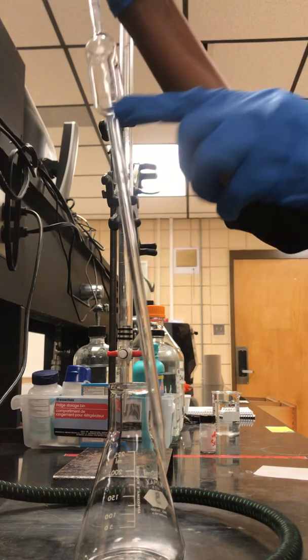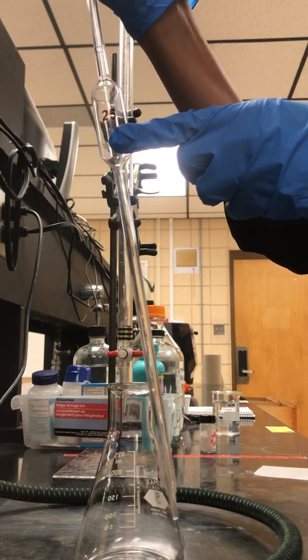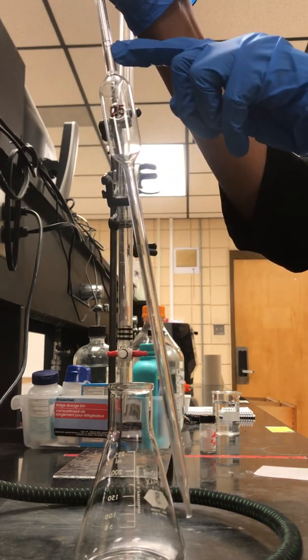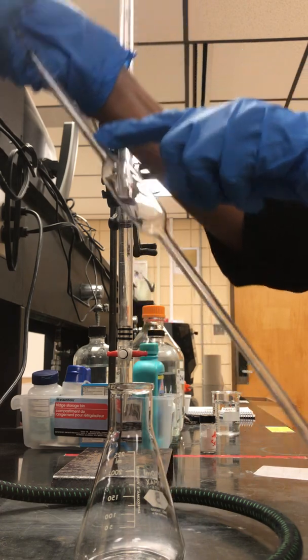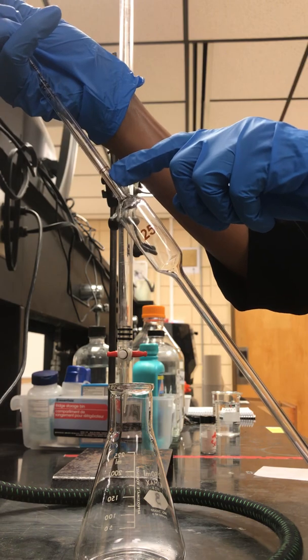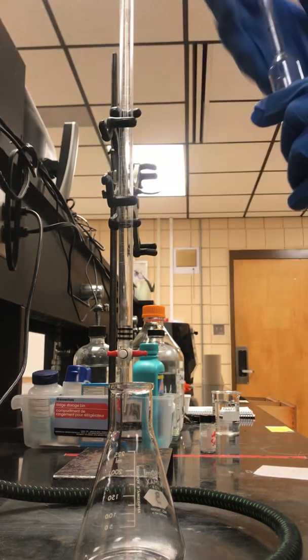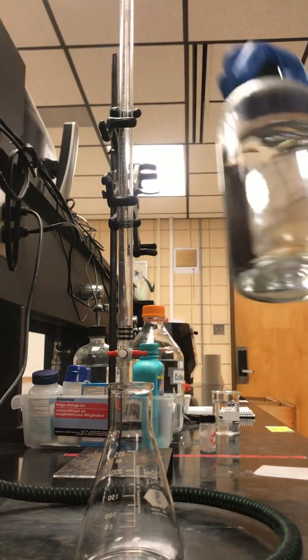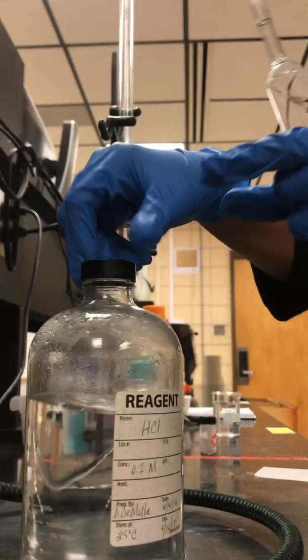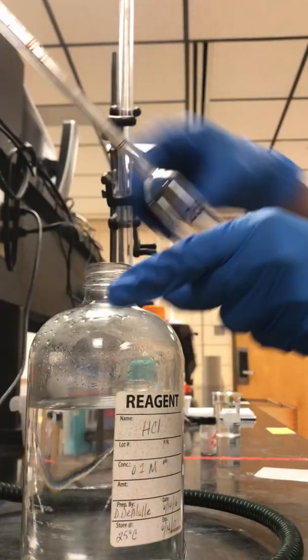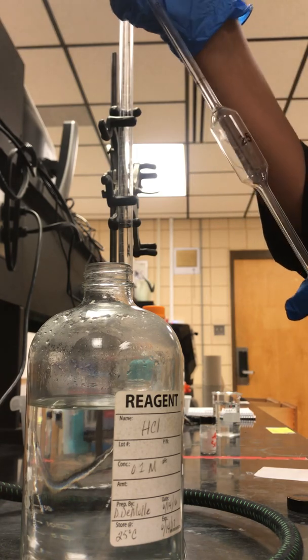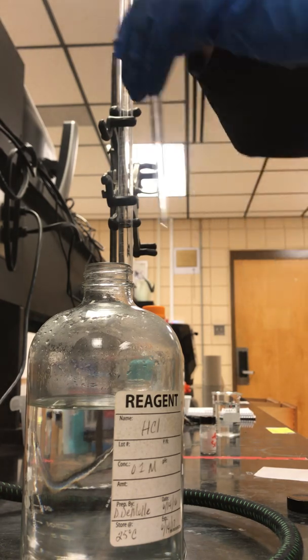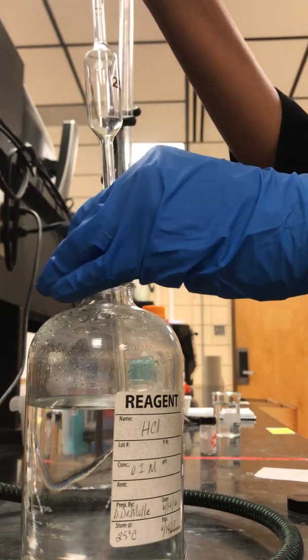The pipette is a 25 milliliter pipette. You see the marking that tells you when it's at 25. You want the meniscus to be there. Take your hydrochloric acid, making sure you read the bottle.